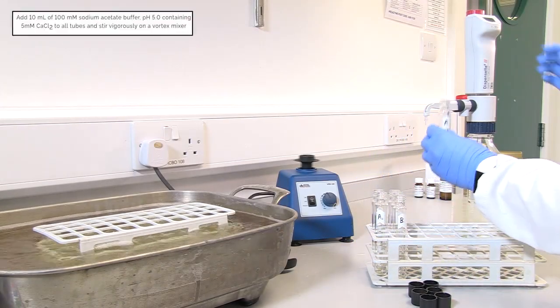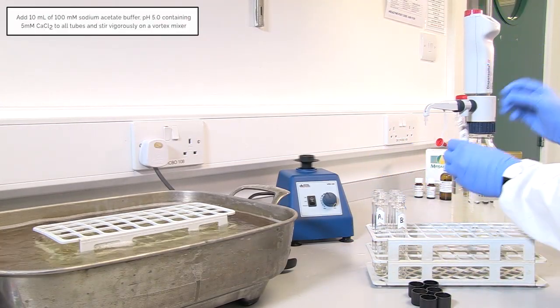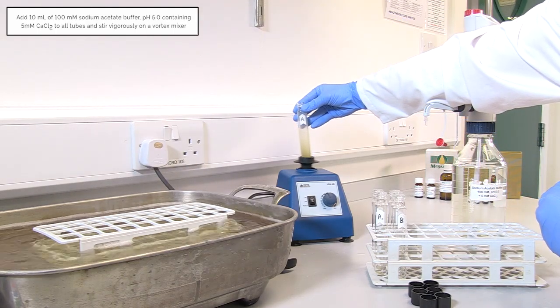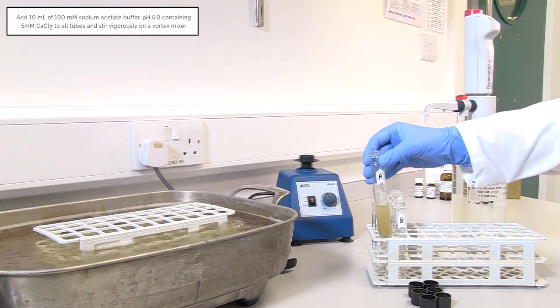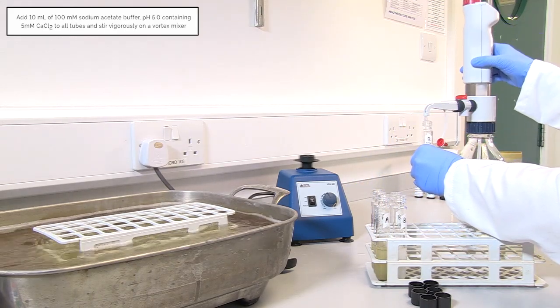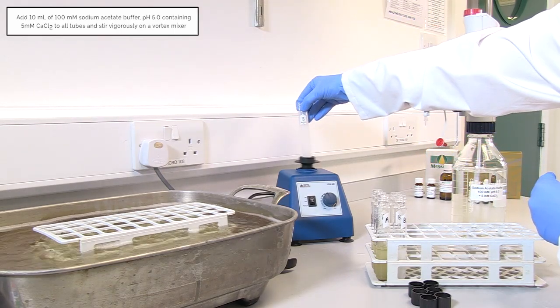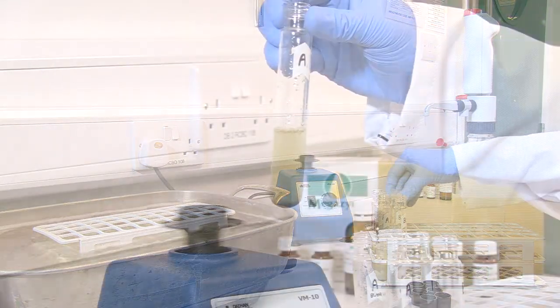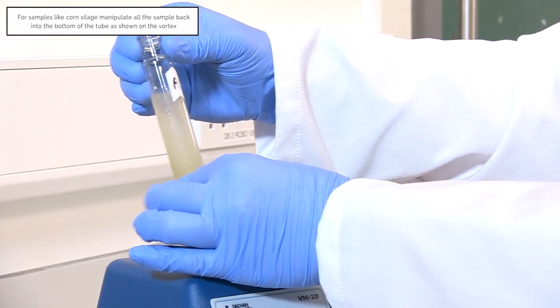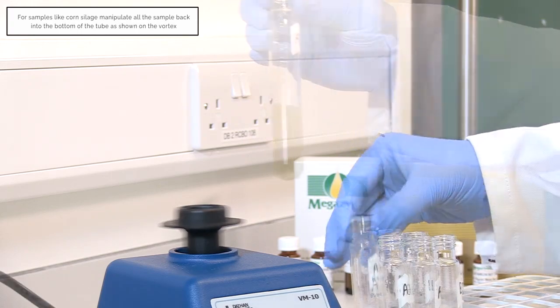Add 10 millilitres of 100 millimolar sodium acetate buffer pH 5 containing 5 millimolar calcium chloride to all tubes and stir vigorously on a vortex mixer. For samples like corn silage, manipulate all the sample back into the bottom of the tube as shown on the vortex.